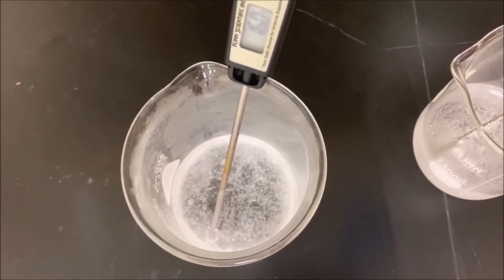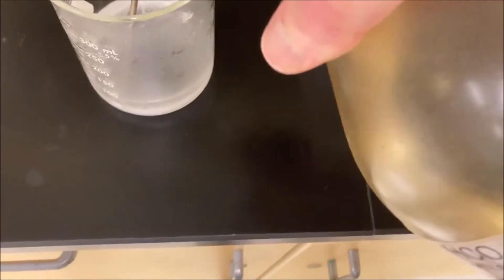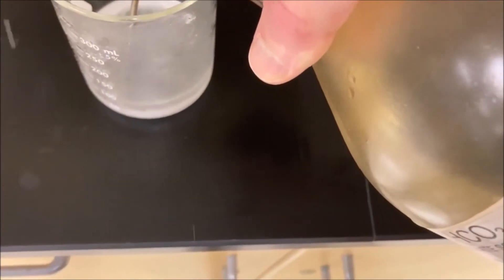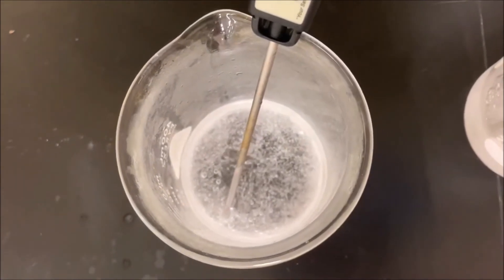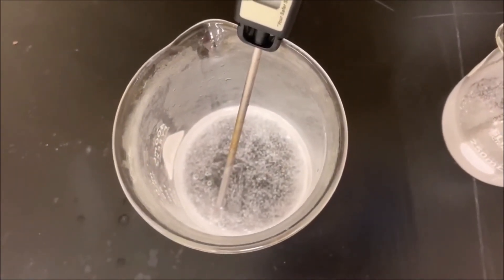So that's very interesting. We're seeing a little bit of reaction happen and then right away it kind of dies down. Seems to be too cold to react.